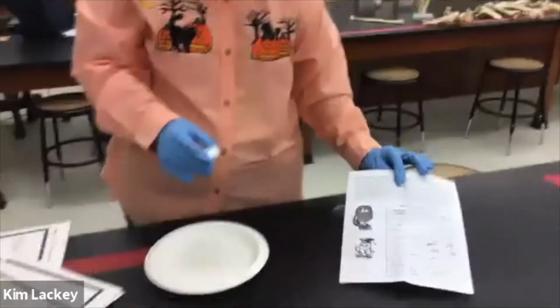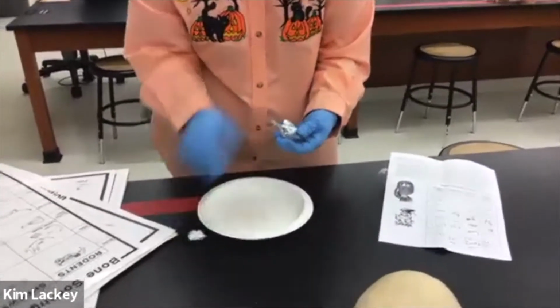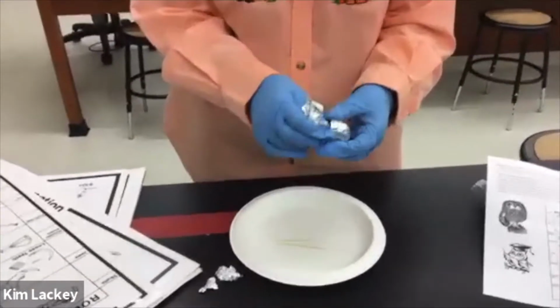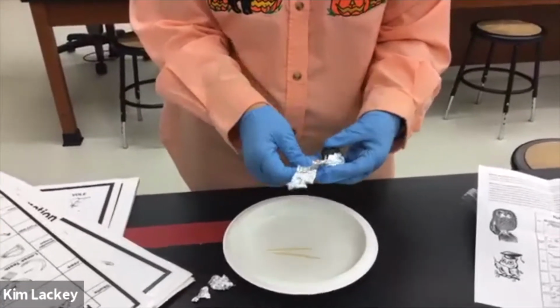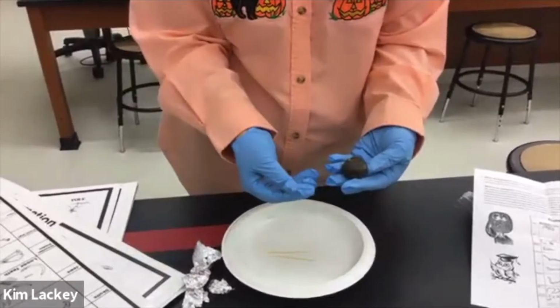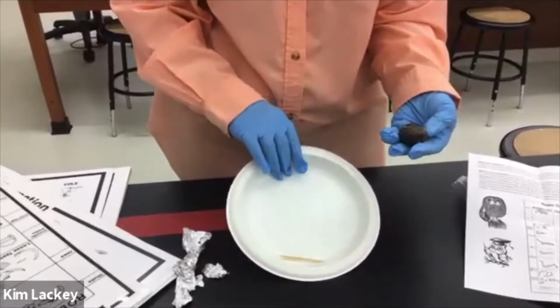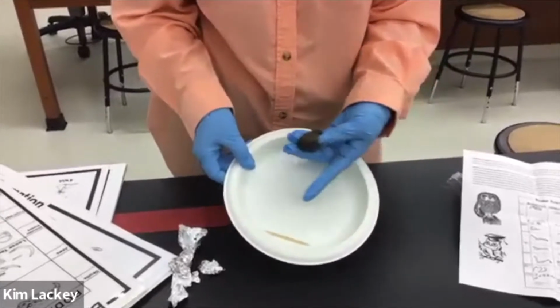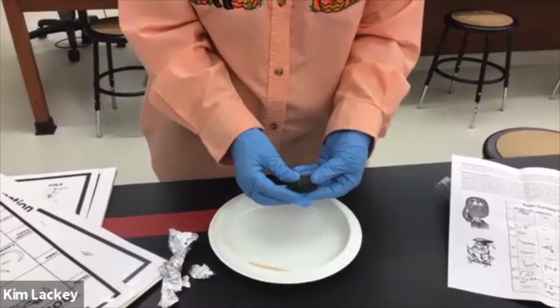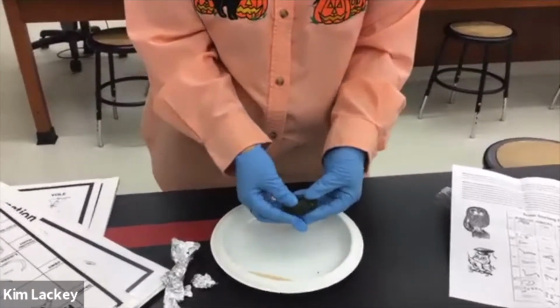So when you get your owl pellet out, you're going to unwrap it. And you'll see sometimes that there's bones protruding from it. And there's lots of hair. So your voles and your moles may have hair and stuff. You can sometimes pull out little individual hairs that are in there. We start seeing some little droppings and castings. So this may have come from one of the other herbivores or something that was caught up in that food web. So don't just rip it apart.